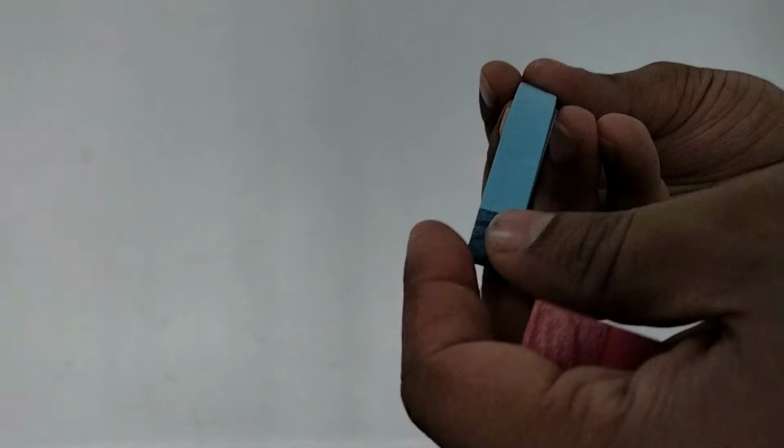Litmus paper, and this contains strips of red litmus, and this is blue litmus paper. Here we are having the strips of blue litmus. Now we are going to determine whether the substance taken here is acid or base. As we studied, the acid will turn the blue litmus to red and bases will turn red litmus to blue.